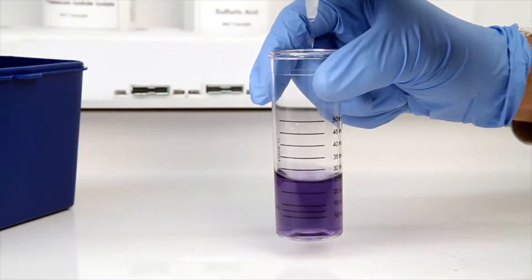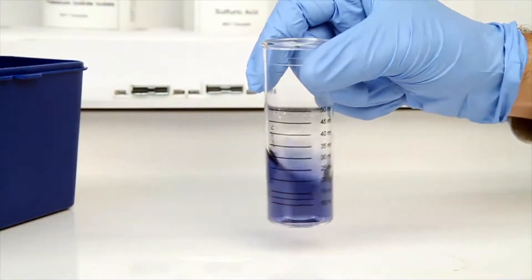According to the Endpoint ID procedure, the titration is complete when the sample is changed from red to blue.